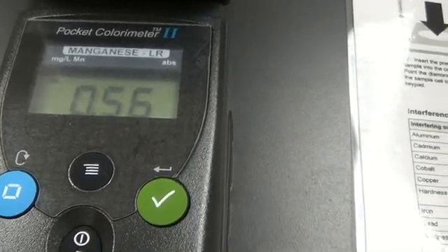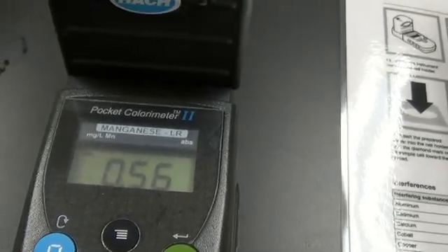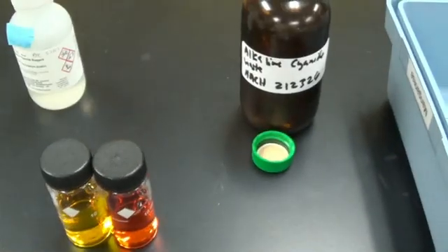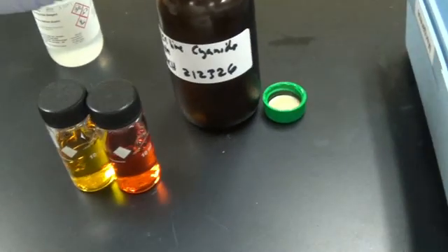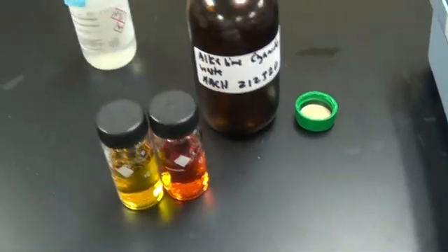There we go, 0.56 milligrams per liter of manganese. When you're done, the waste has to be disposed of properly. Add it to a waste bottle for proper disposal because of the alkaline cyanide reagent.